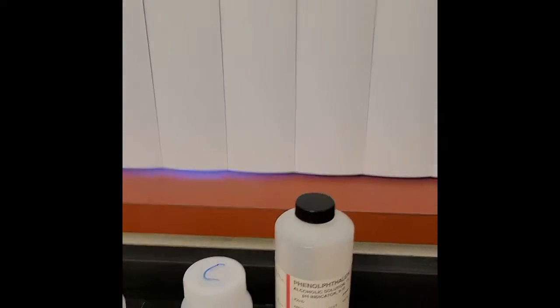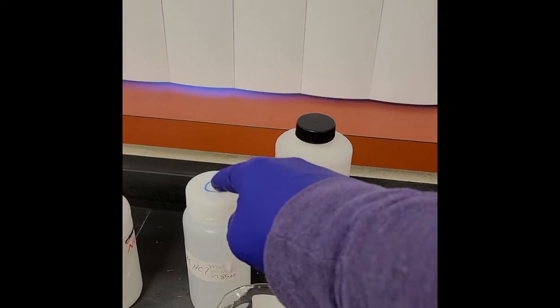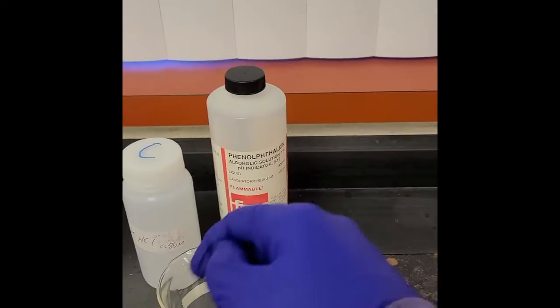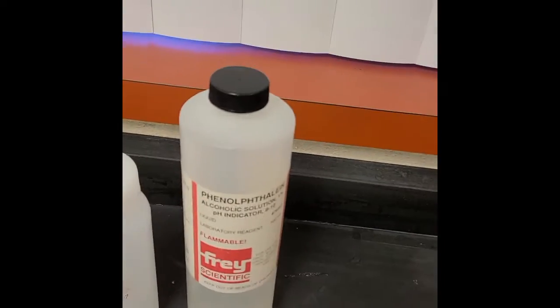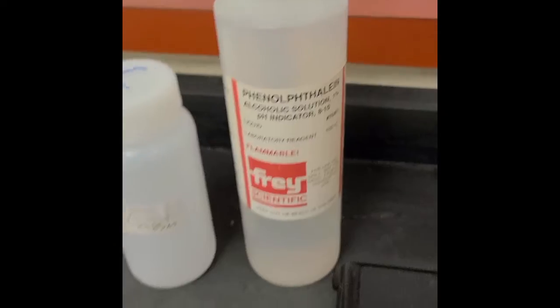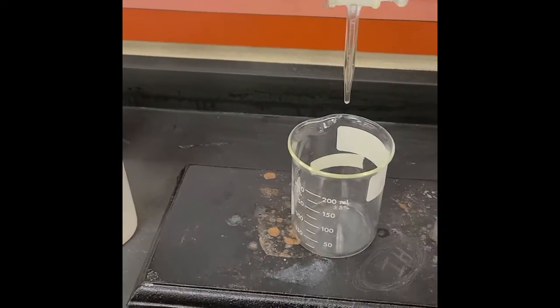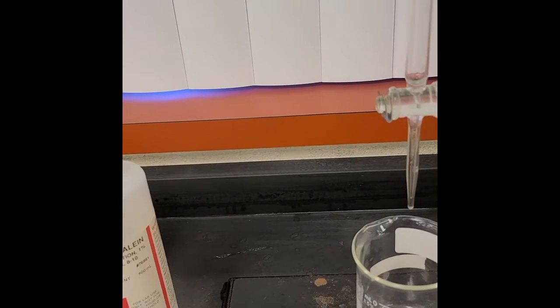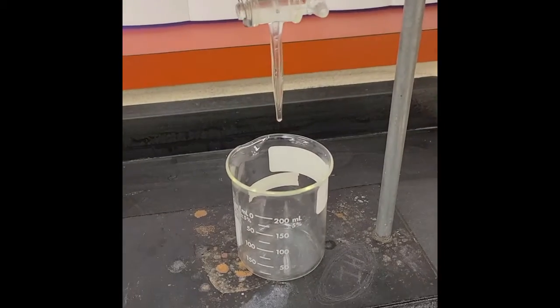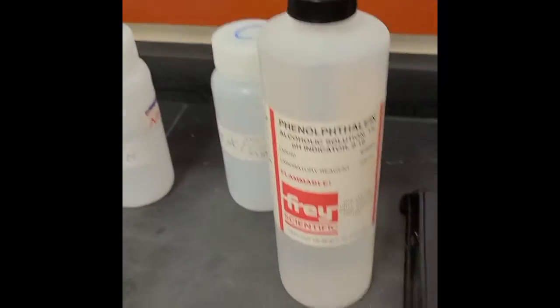So that's why we're going to do this titration, where I put sodium hydroxide into this burette, put about, I think, 25 milliliters of hydrochloric acid into this beaker, and then using this stuff called phenolphthalein, hope I said that right, we're going to put a couple drops of it into the hydrochloric acid, and then slowly drip sodium hydroxide into the hydrochloric acid filled beaker to figure out what the molarity of that is.